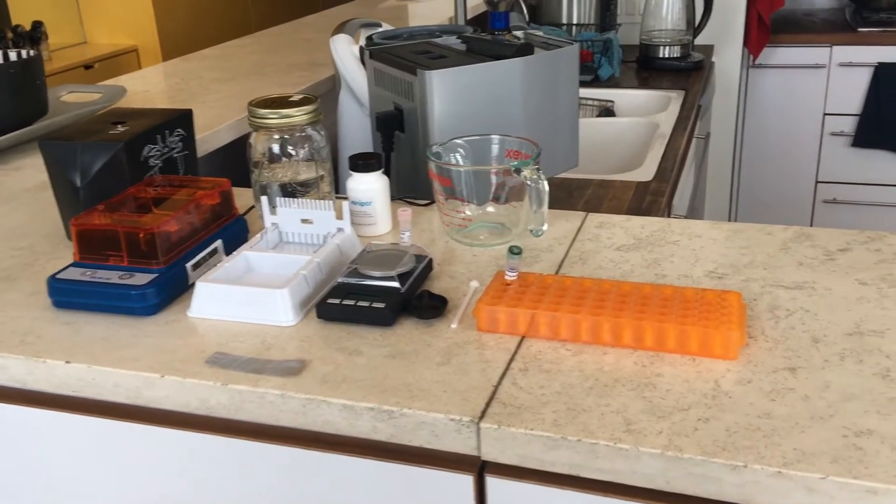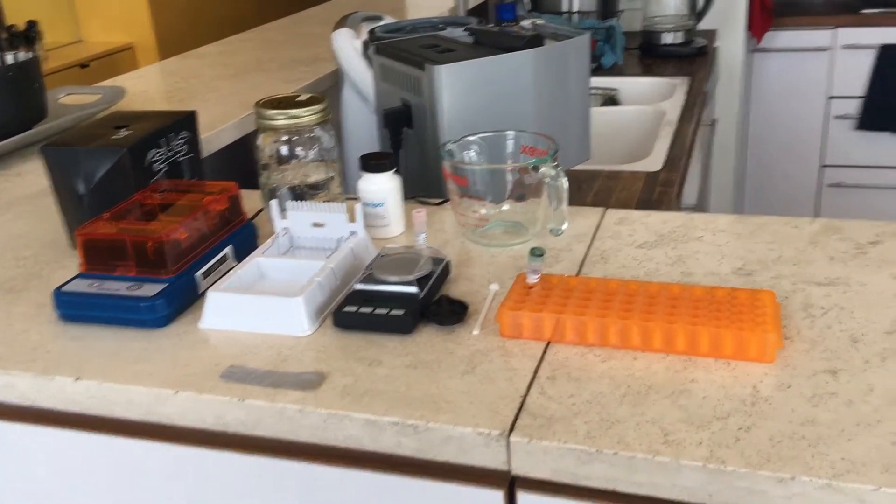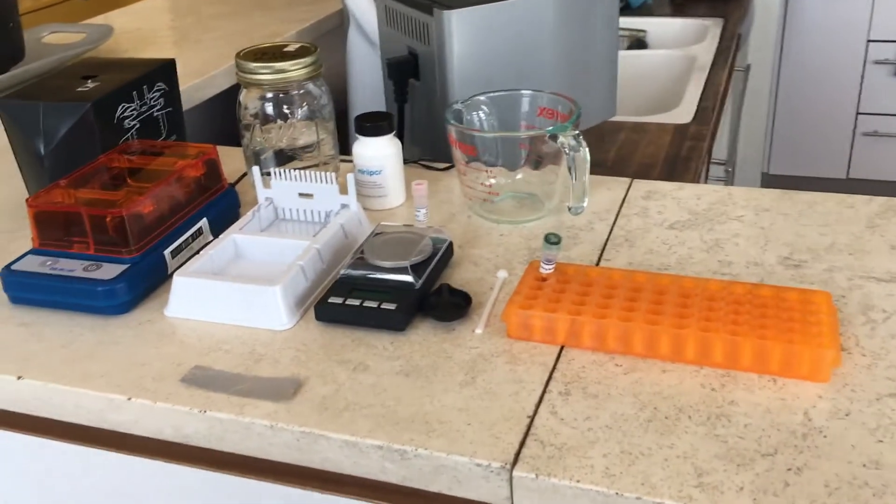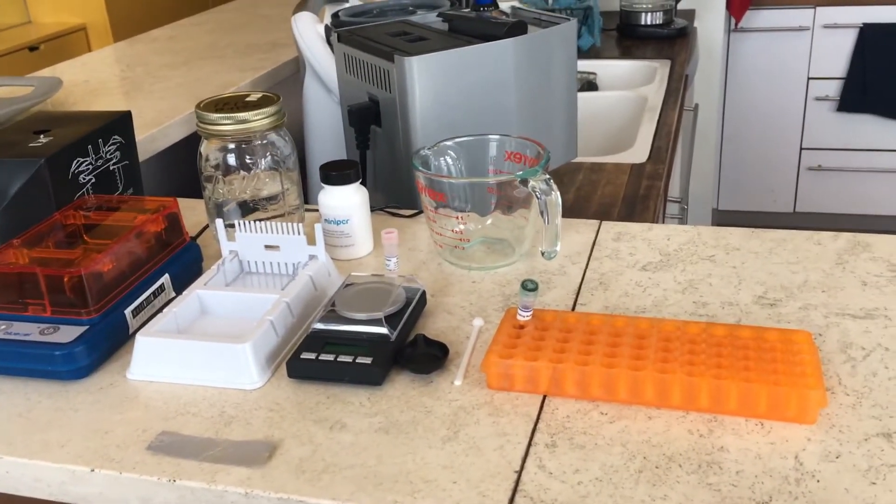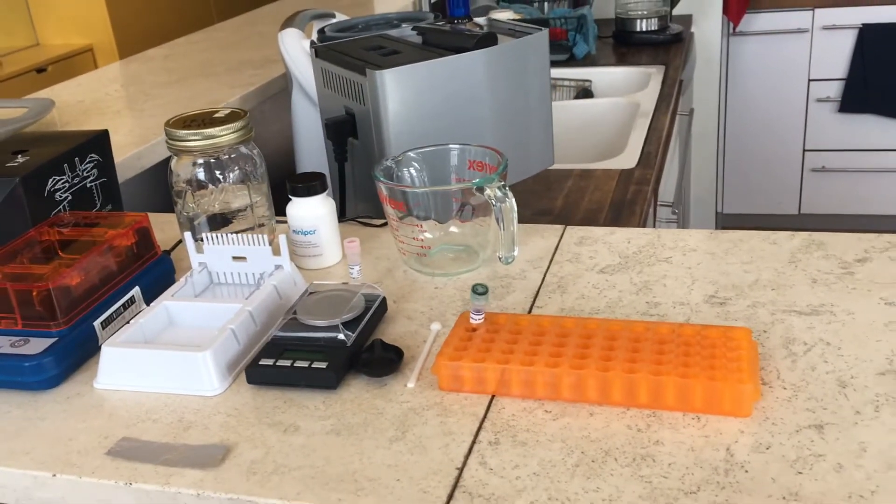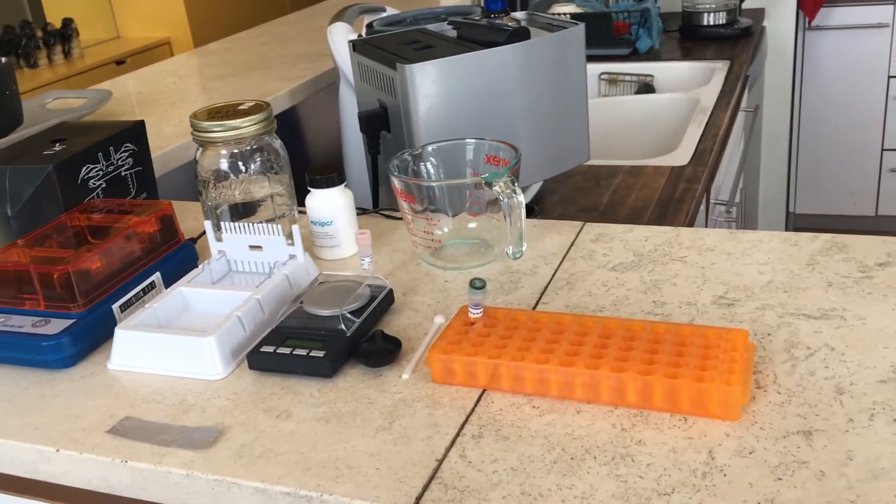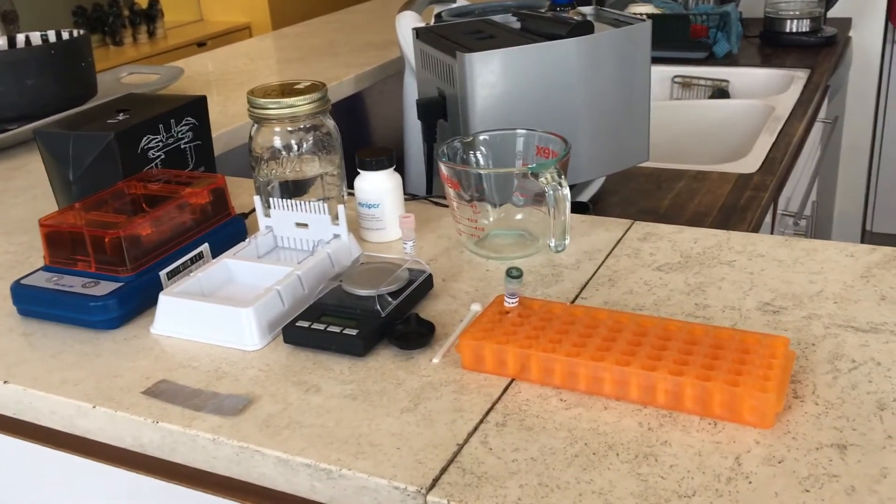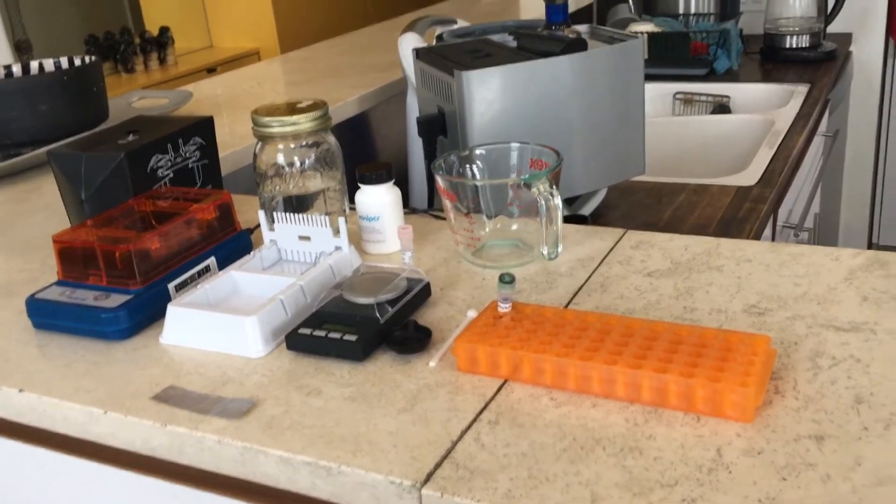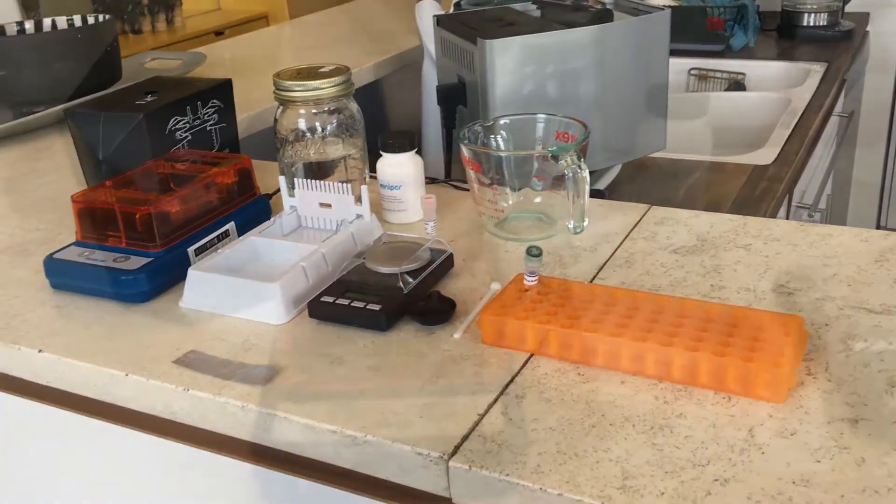Once we've amplified the DNA in our fungal tissue, we want to test them because we could just send off the amplified DNA to the lab, but it doesn't always work out. Sometimes things fail. So rather than just paying whatever it costs to have them sequenced, we're going to do a test.